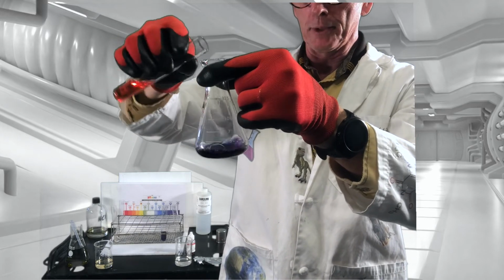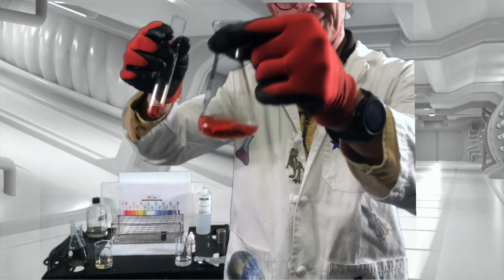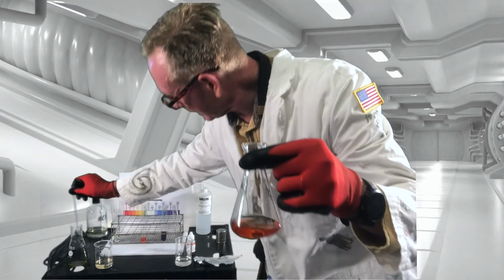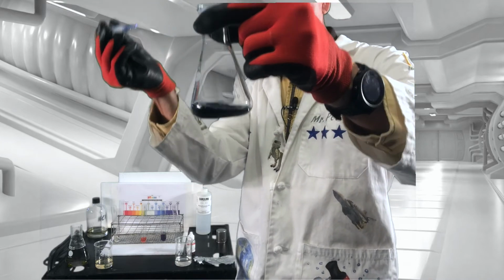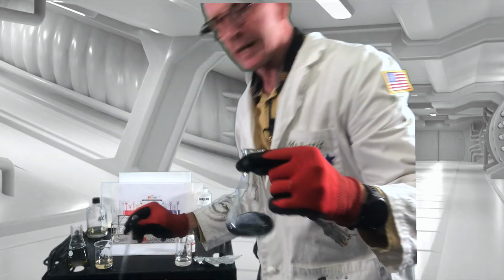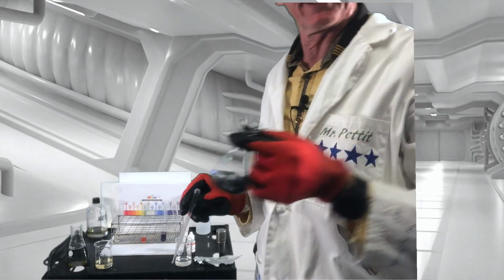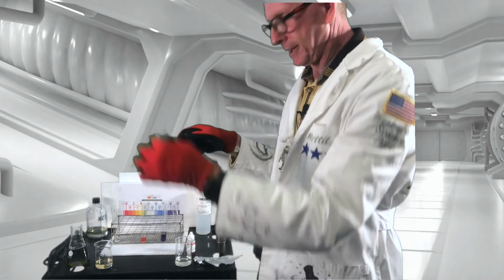still saying purple, took a little bit more, eventually did take it into, I'm going to go back to, I think I can use this one. And yeah, it didn't take much at all to take it all the way in, but we're more at maybe a bluish hue now, if we can see it up against the background.